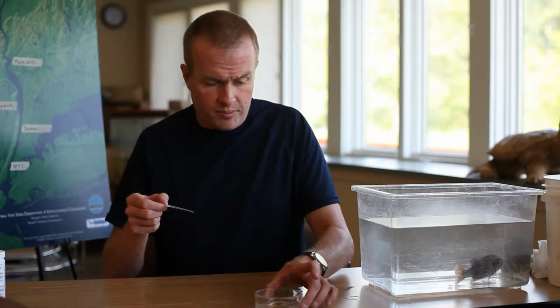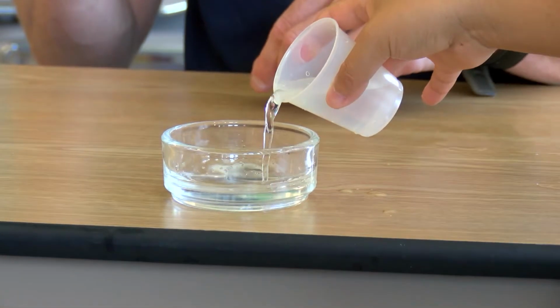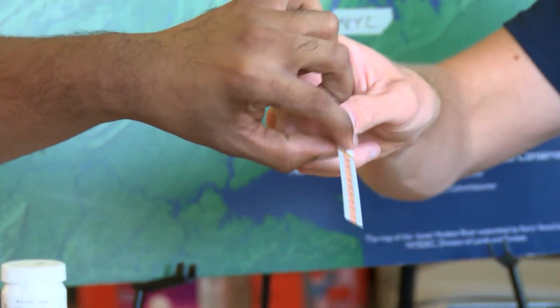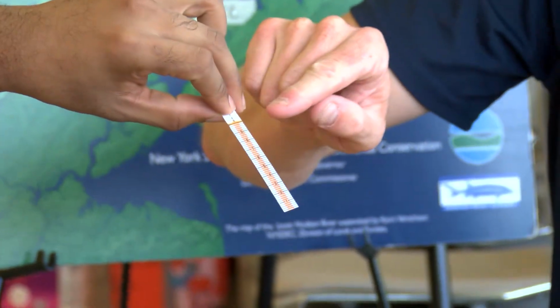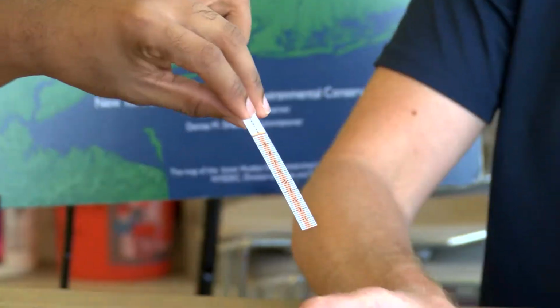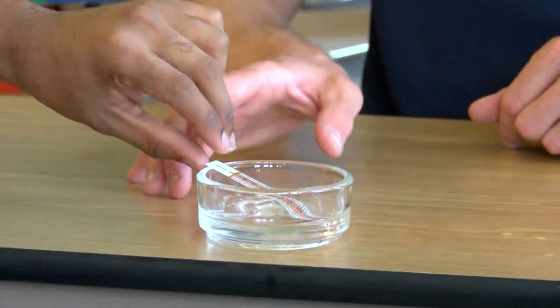And what I'm going to do is, Michelle, can you take a little bit of fresh river water and just put about a 1/4 inch in this petri dish here. Okay, that's perfect. Now, Martise, grab just the top of that quantab, and I want you to put that in the petri dish so that the bottom is in the water, but make sure that that yellow strip is out of the water. All right, you should be able to lean that right in there.